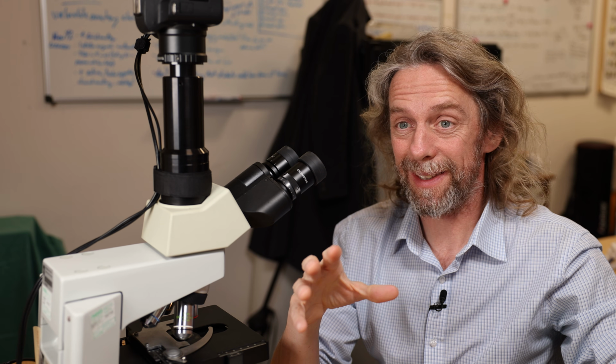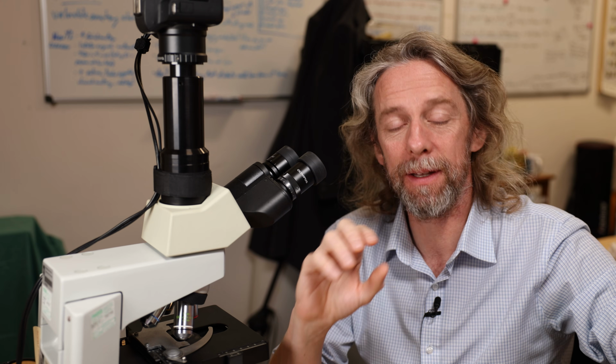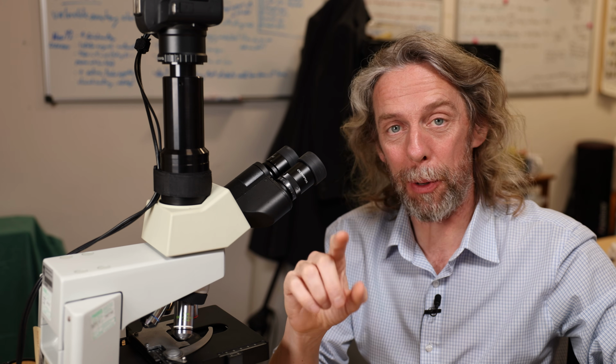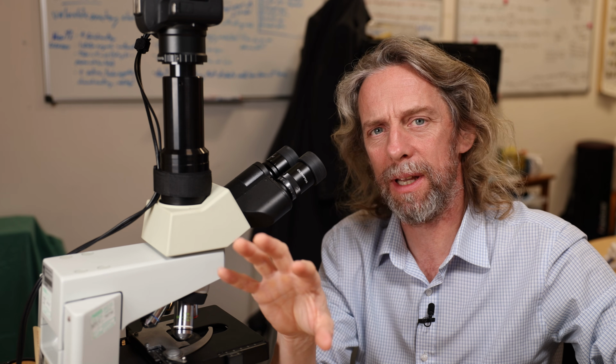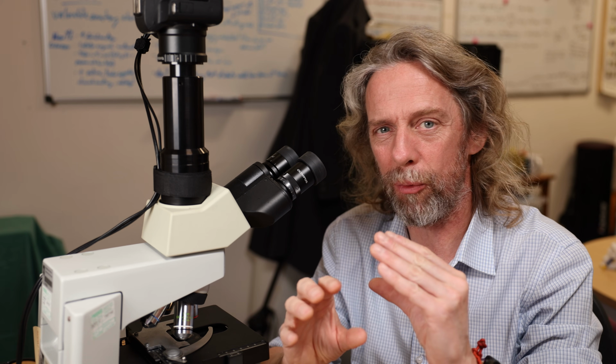Last week we looked at the microscopic anatomy of the kidney. Very complicated. This week, let's follow the path of urine down the ureter. Very simple, should be quick. We were looking at nephrons last week, so we were looking at the active component, the filtration component of the kidney. Let's just start off with the kidney again.